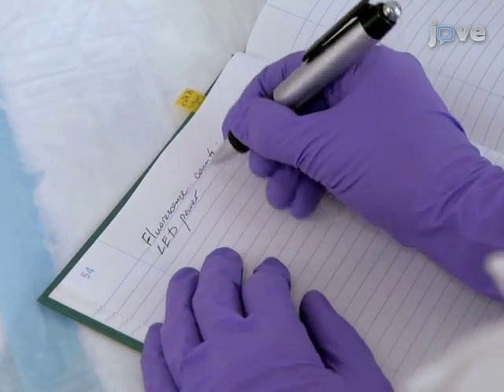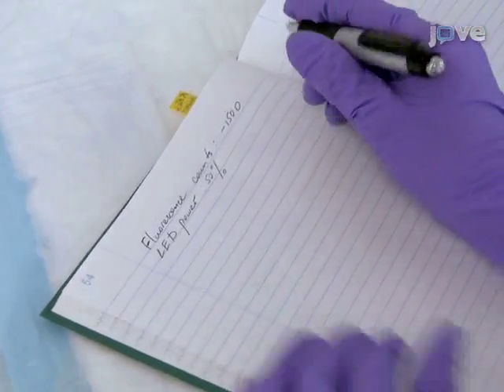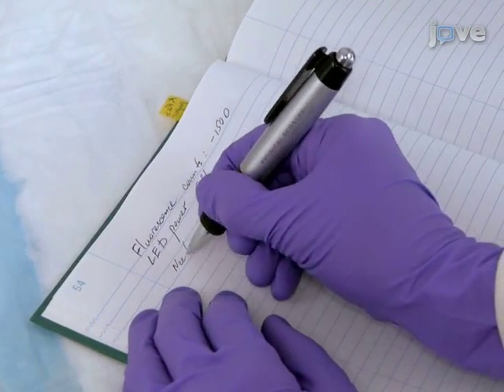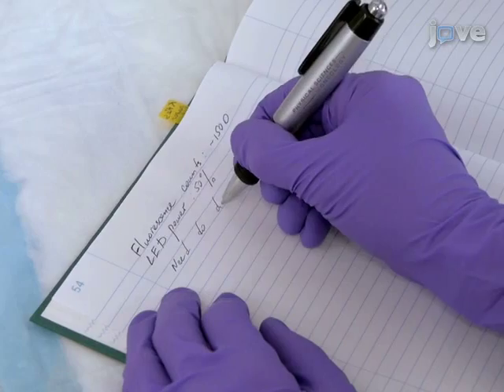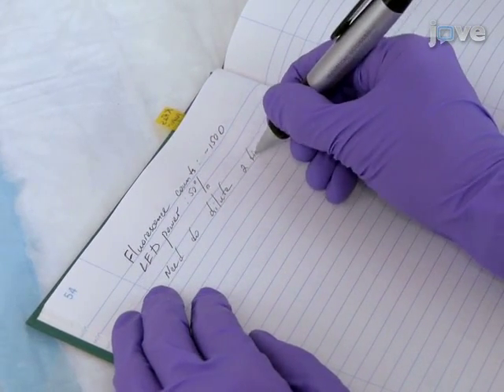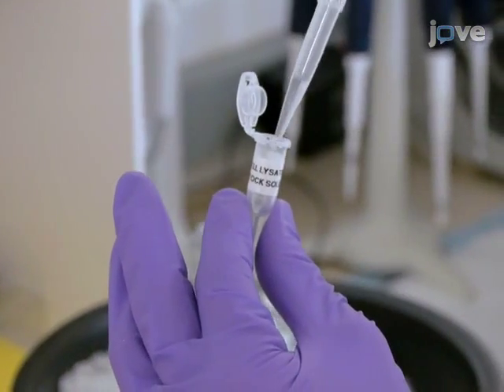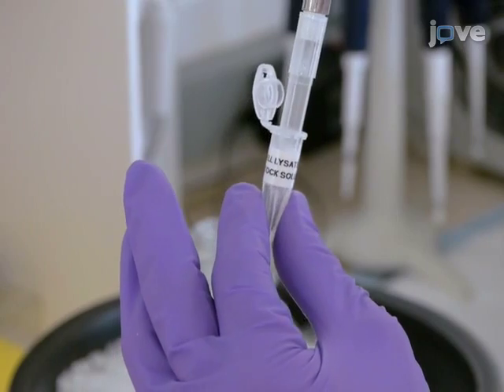Calculate the cell lysate dilution to yield the optimal level of the fluorescent target protein in the binding reactions. Final protein concentration should be close to the expected binding dissociation constant or lower and should be adjusted to obtain the necessary number of fluorescence counts in the final solution. Proceed to dilute the cell lysate with MST buffer.